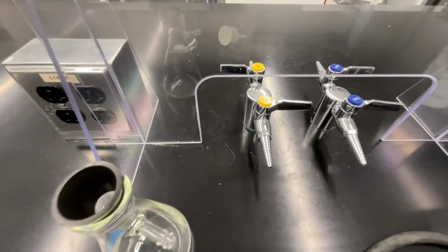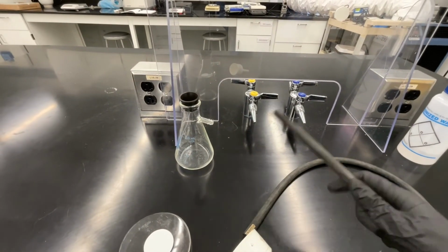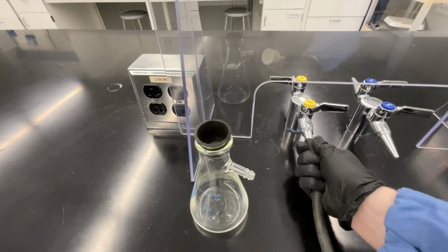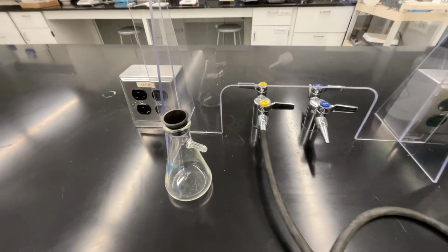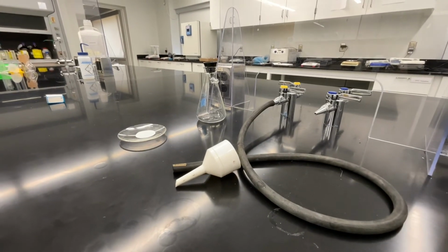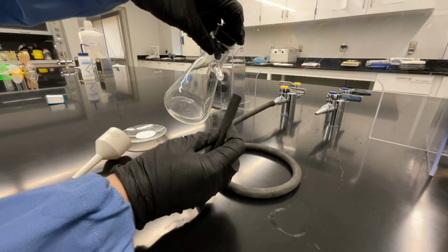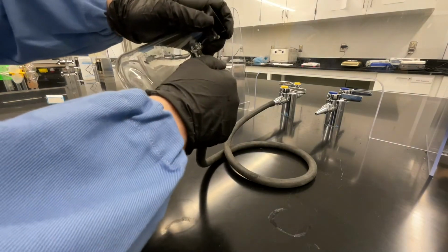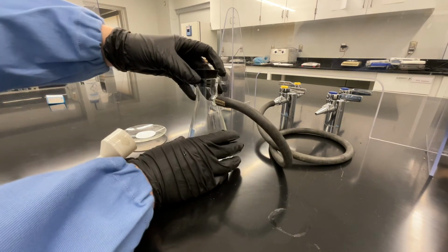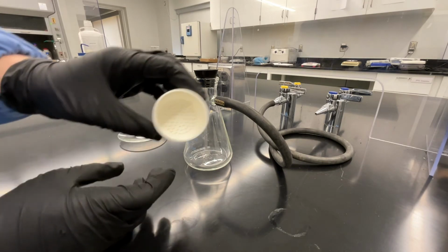Back at your lab bench, we can finish setting up our vacuum filtration. You're going to connect one end of your hose to the vacuum line. You don't need to shove this on too far, just make sure you've got a secure fit and make sure that you're connecting to the vacuum line, not the gas line. You'll connect the other side of the hose to the arm of your filter flask. Make sure that the hose isn't going to cause the flask to be unstable. Just adjust it so that it seats comfortably.